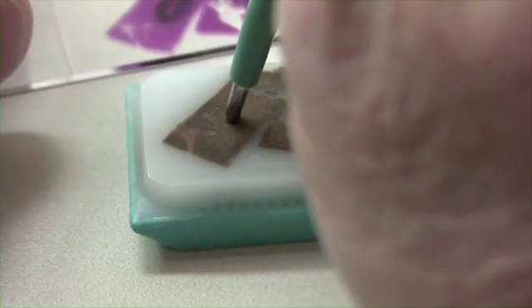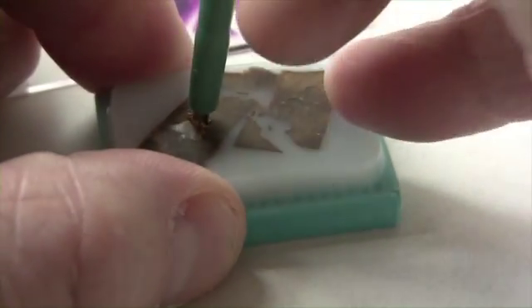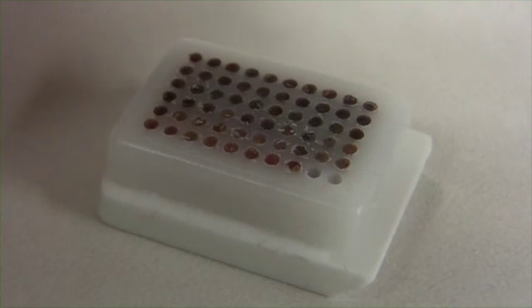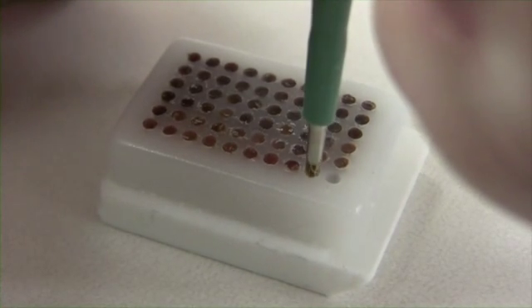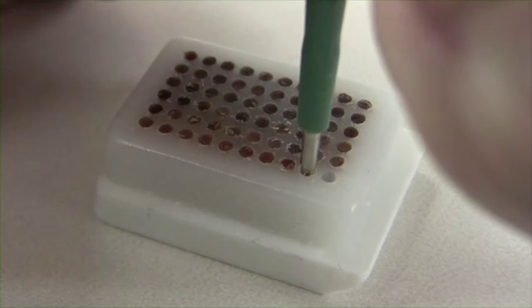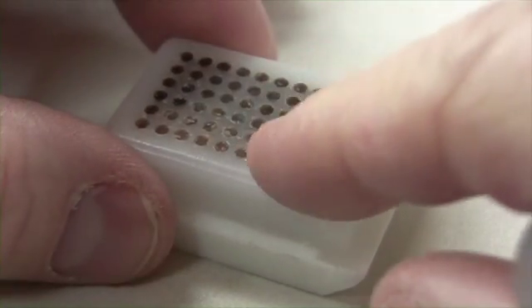I also like to wait till the array block is at room temperature before I begin putting punches in it. This will reduce the chance of it cracking. You can flatten the punches out from time to time by either pressing a glass slide on top of the surface of the array block or flipping the block over and pressing it gently on the surface of a countertop.